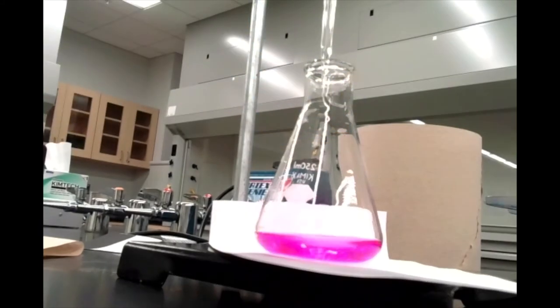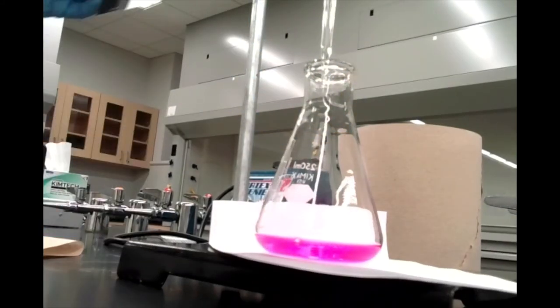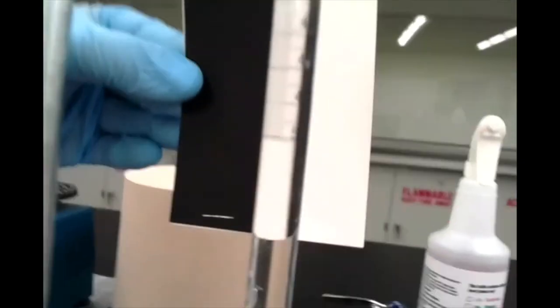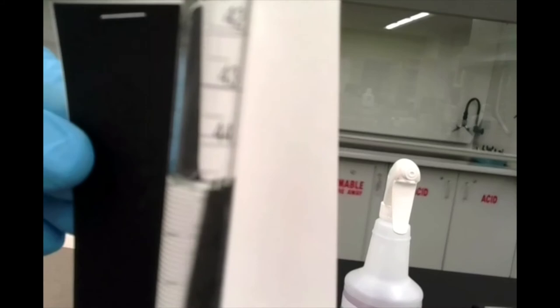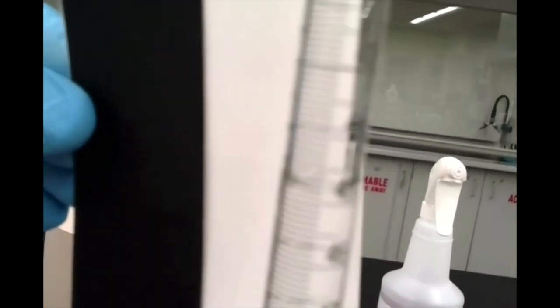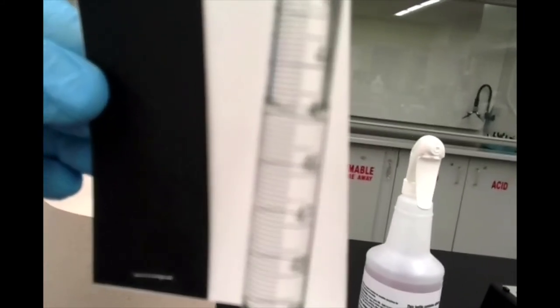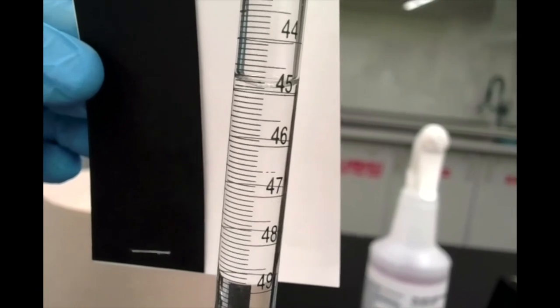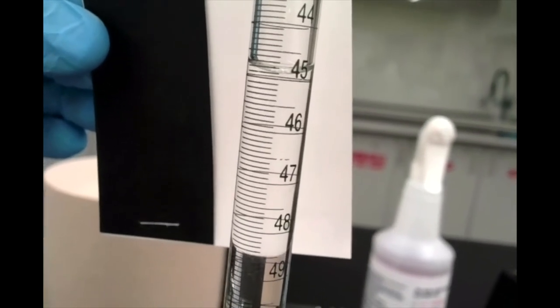There we go — when you add one more drop and that pink color stays, that's the perfect endpoint right there. Let's make a note of that final volume. I'll take a picture with my phone so it'll be a little bit more visible.